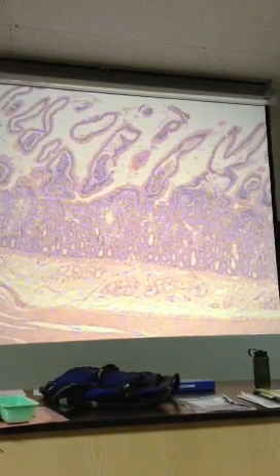Yeah, you do need to know what kind of epithelia all of these organs have. The stomach was simple columnar. It's hard to identify from the slide, but you should know that. The rugae, I forgot to mention from the stomach, is a wrinkle or a fold in the stomach. It's a macroscopic structure, so I didn't even bother to put it up there.